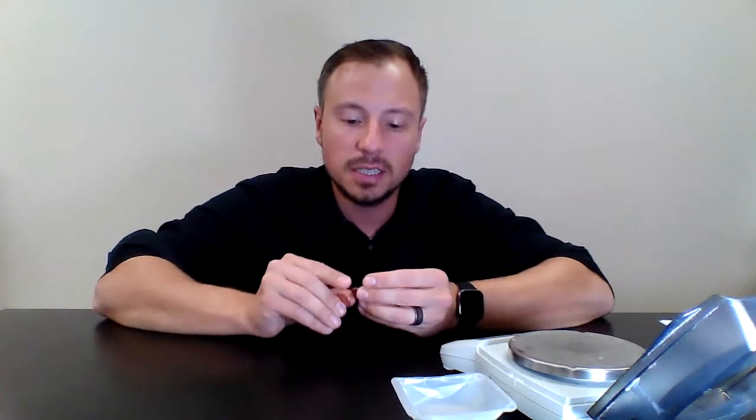This lab is called My 2 Cents. So in this lab, we're exploring moles and molar mass and how to convert between grams to moles, moles to grams. And the whole idea behind this is the end result is to calculate the number of atoms that are in a penny. So I call this My 2 Cents because for this lab, we're going to need 2 pennies.